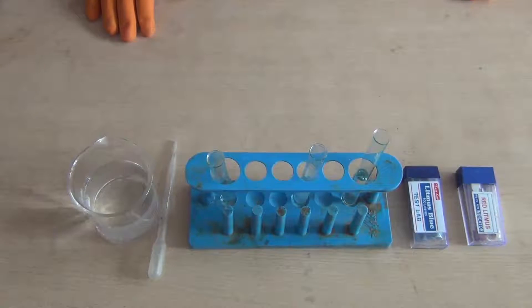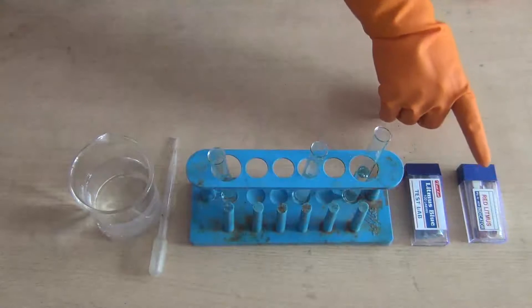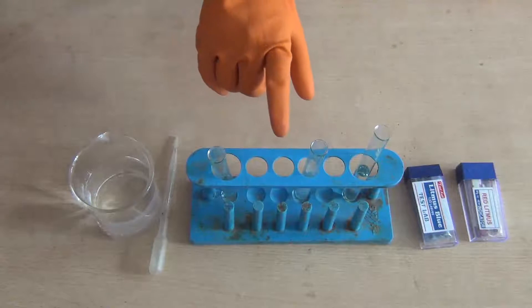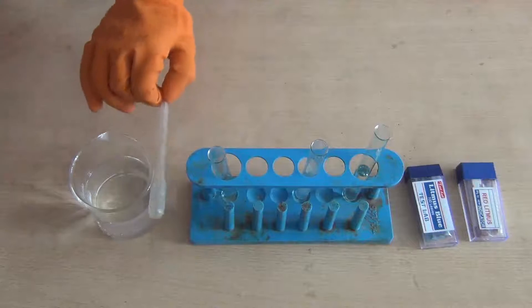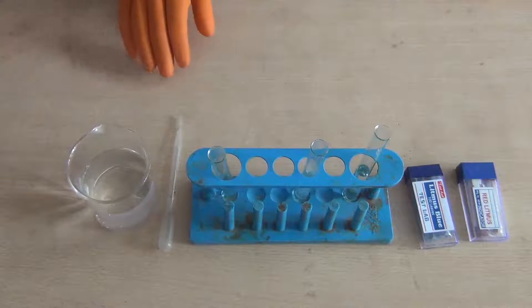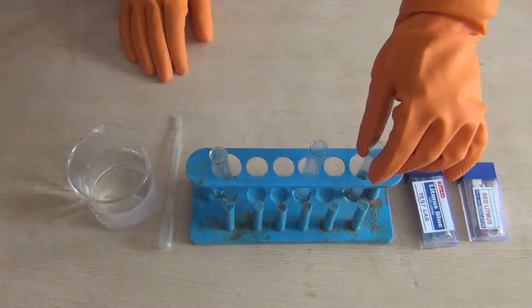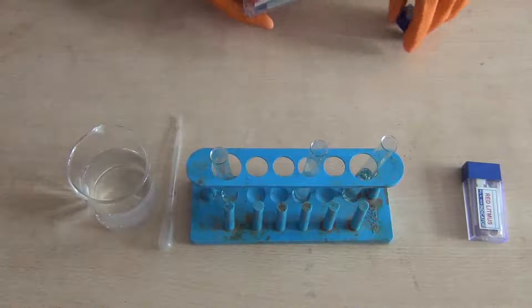So students, to conduct the activity, we have taken some materials: red litmus paper, blue litmus paper, three different solution samples, a test tube, a dropper, and some amount of water. First, let us take the first solution sample and identify its nature. Let us take a leaf of blue litmus paper.